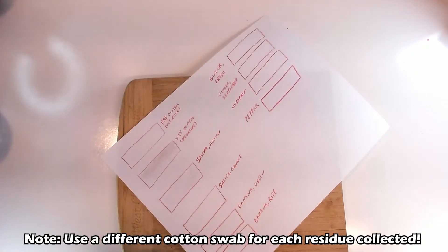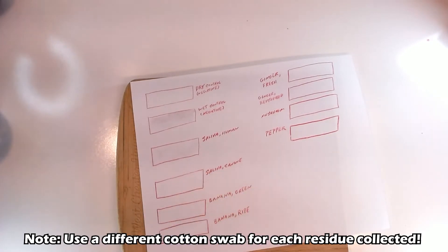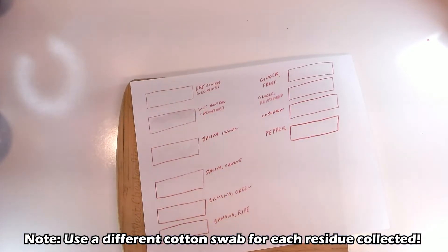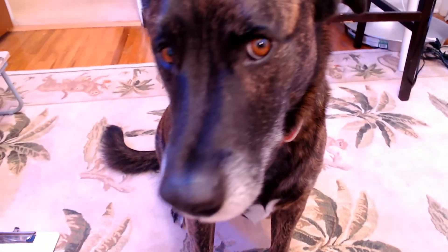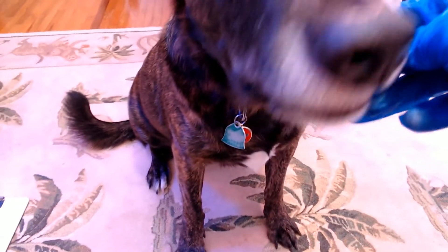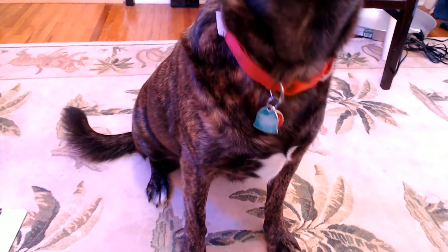Now that all the setup is done, let's grab some cotton swabs and collect some residue. Human saliva should contain a large amount of amylase because our diets are pretty rich in starchy foods. However, dogs are descended from wolves, which are a good deal more carnivorous, so should we expect to see the same results from my saliva versus Edward's saliva?